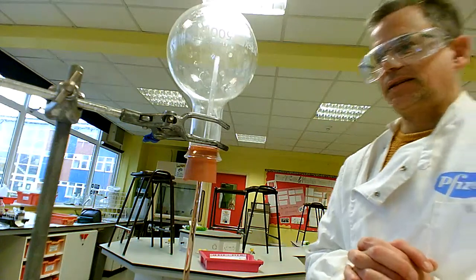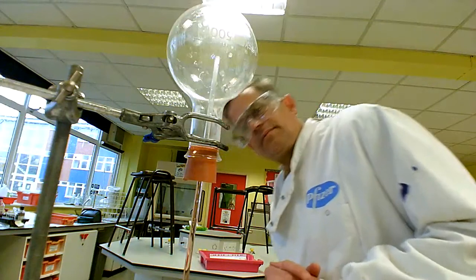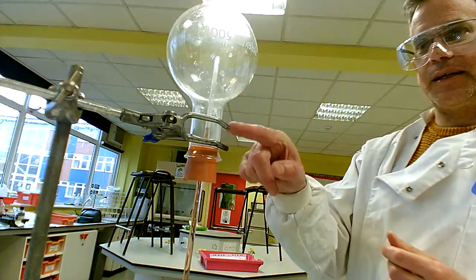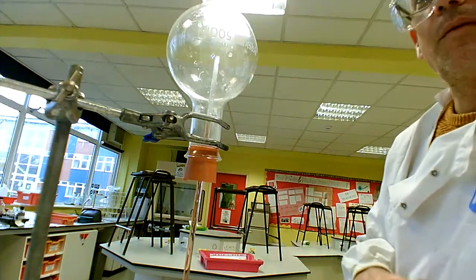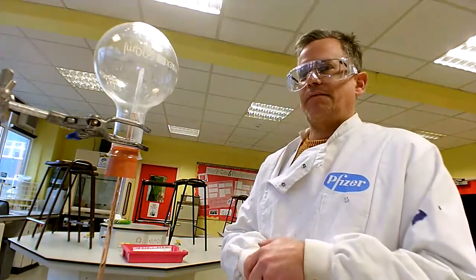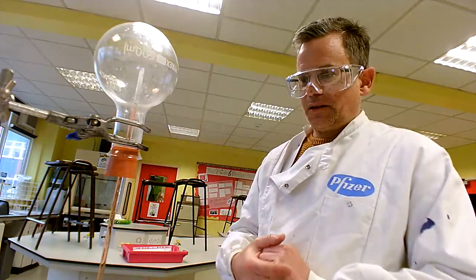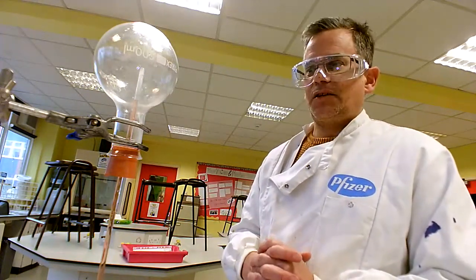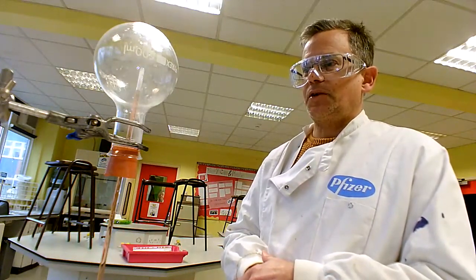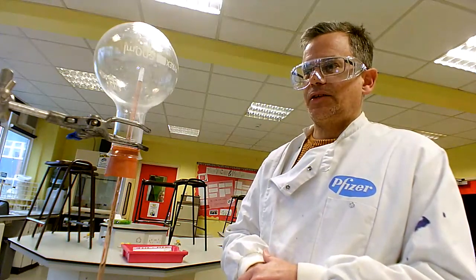The liquid is continuing to rise. It's now just above the level of the second bung. This water has risen about 50 centimetres vertically upwards, which water really isn't supposed to do — something is pushing it upwards and it's about to make its way into the flask.